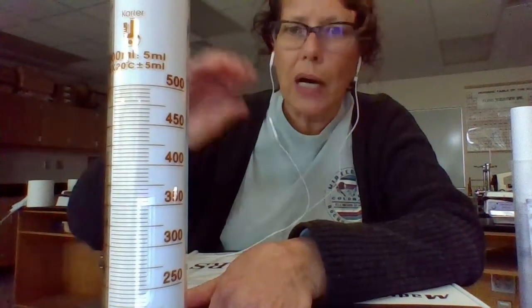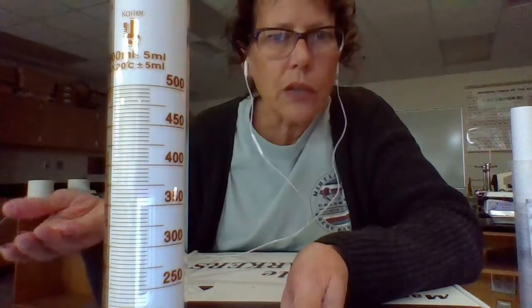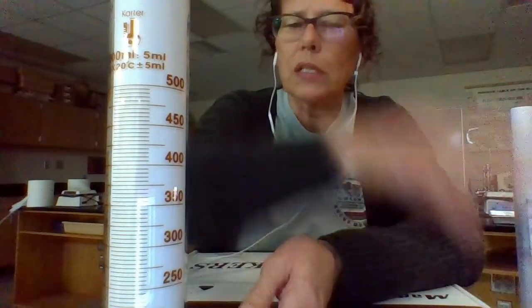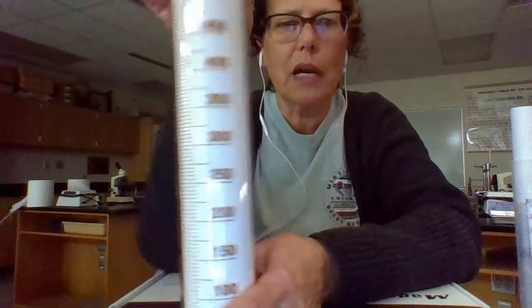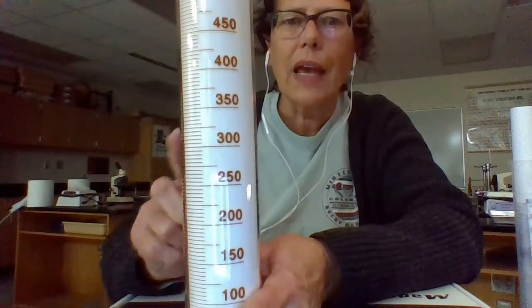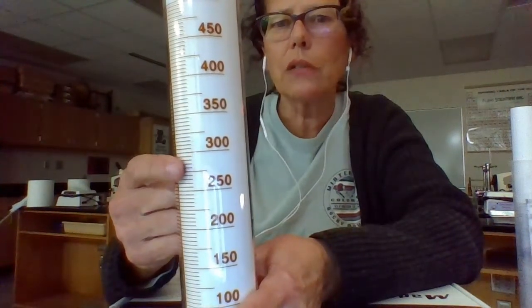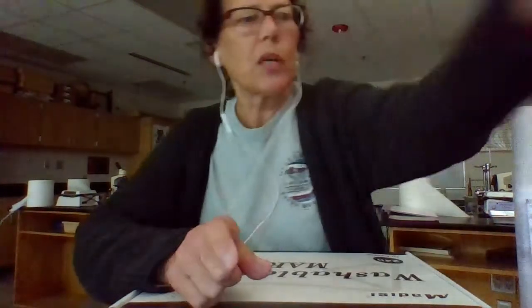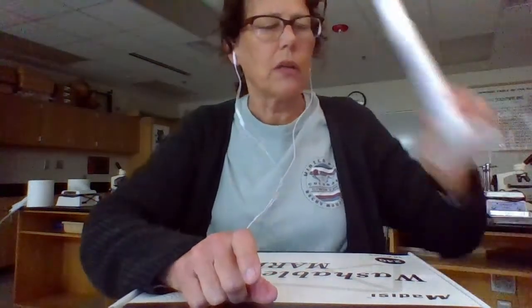If your instructions say, go get about 200 milliliters of water, if we say about 200 milliliters, accuracy must not be important. And so then it's perfectly fine to use a beaker to do it. Okay, so I'm going to set this one aside. I brought this one out to show you because it's got very nice colorful letters on it, but this is really too big for our ordinary uses. And actually, 5 milliliters between the lines is not super exact. We can get much more exact if we use a different graduated cylinder that's made for more accurate readings.